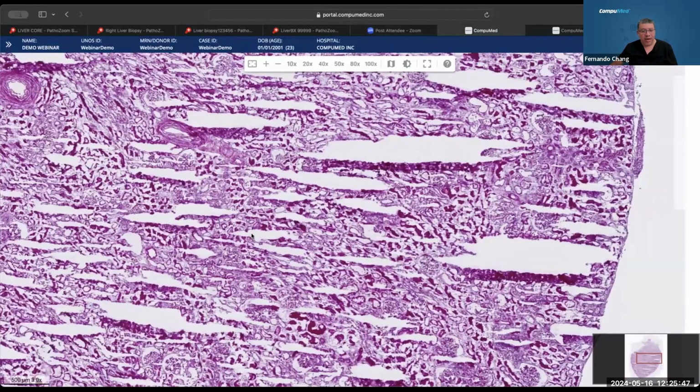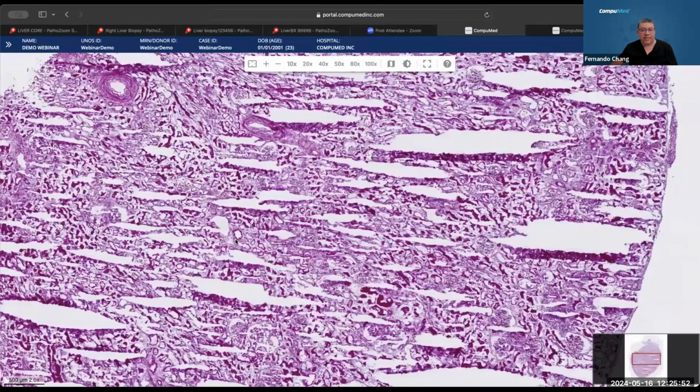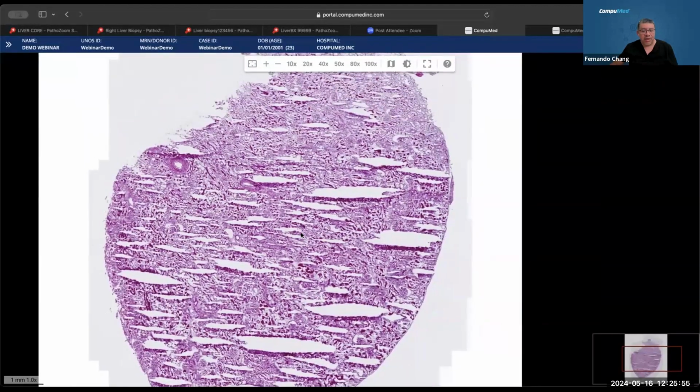This is our wedge, and it's all over. The tissue was supposed to be well preserved, but in this case, they let this tissue sit too long, and it's extremely cold. At the time of freezing, it took a little longer to freeze. That's the first part. The freezing artifact and the compression artifact were created already, and then it was left too long before cutting, and that's what created this shattering. So there are these 2 components happening here, at different times and in different parts of the procedure, that ended up having this result.